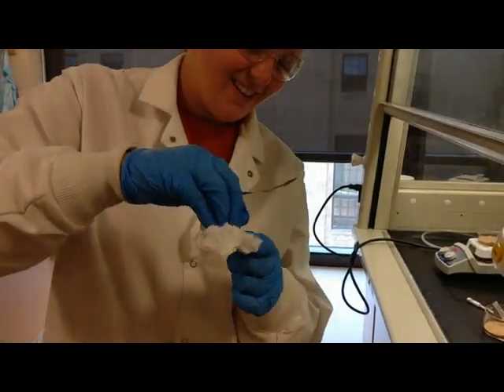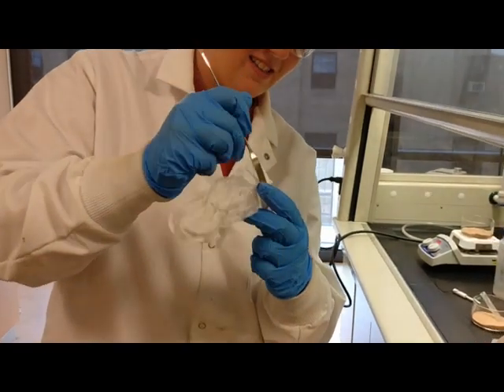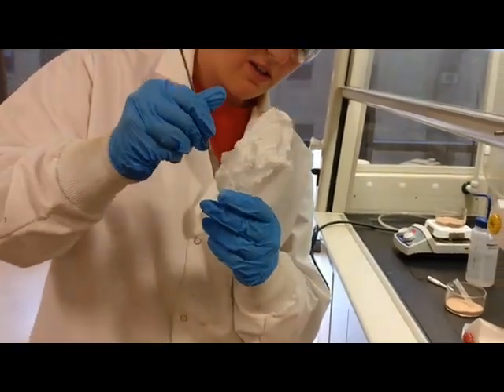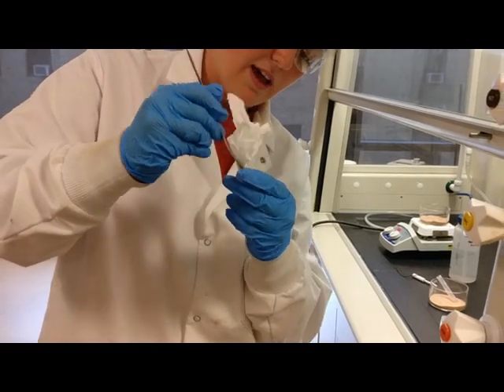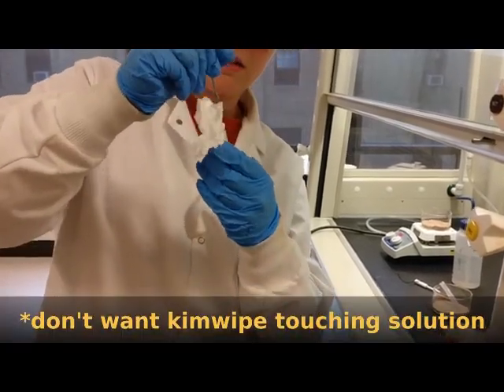And then you have to clean the ground glass with a chem wipe and a spatula to make sure the plunger has direct contact with the glass.